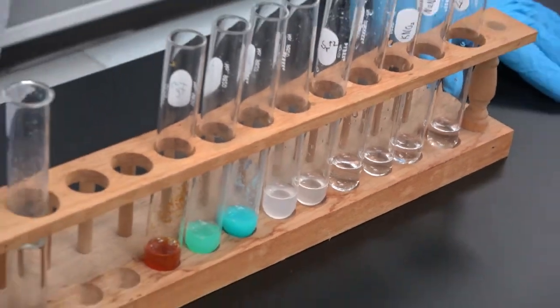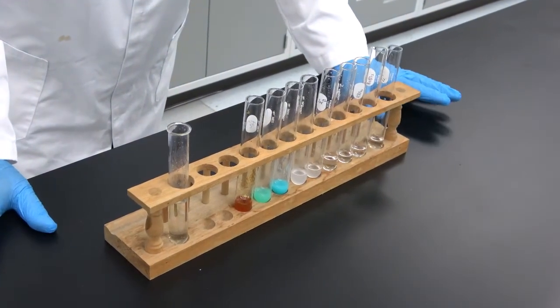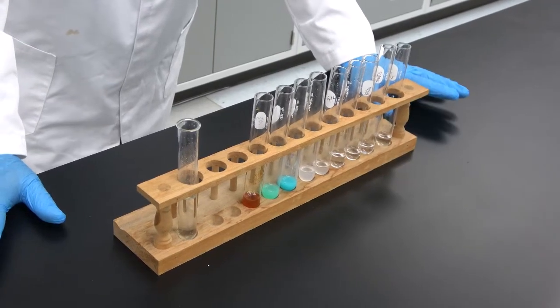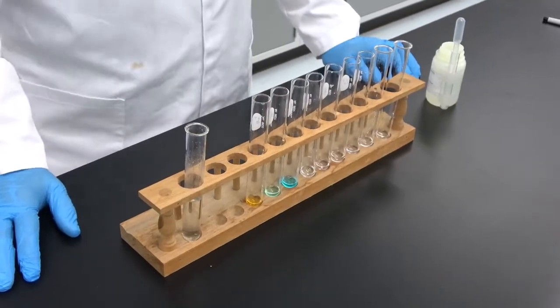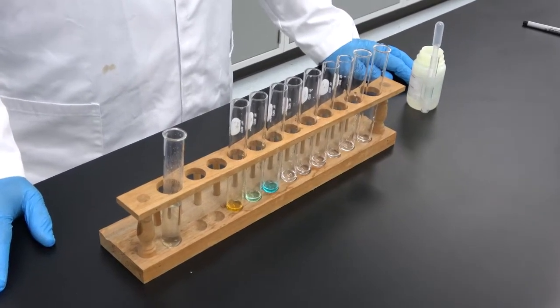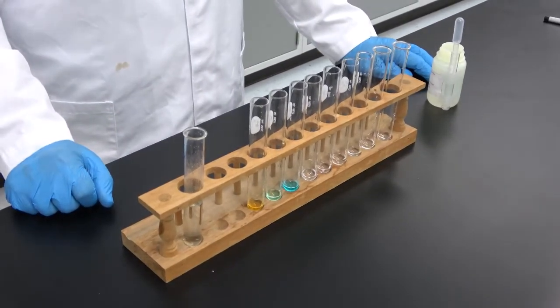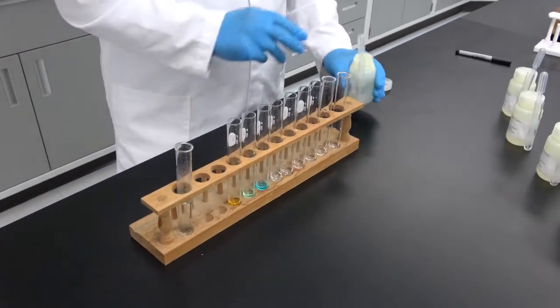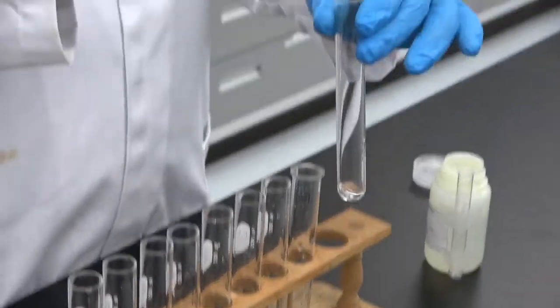This takes care of the second part of the experiment, which is the reaction with ammonium hydroxide. The next one is going to be with ammonium sulfate. The last reaction we are going to perform is with ammonium sulfate, and see what happens with the sulfates of each one of these ions that we have here. We start with lithium, and here is what happens with the lithium sulfate.